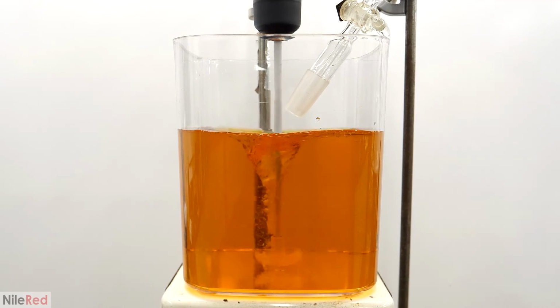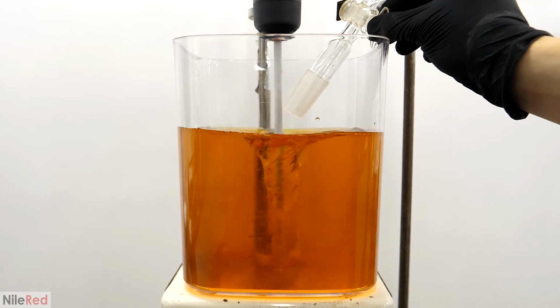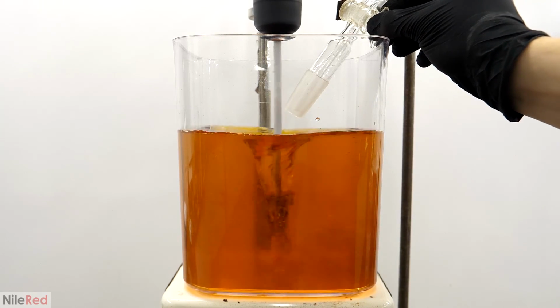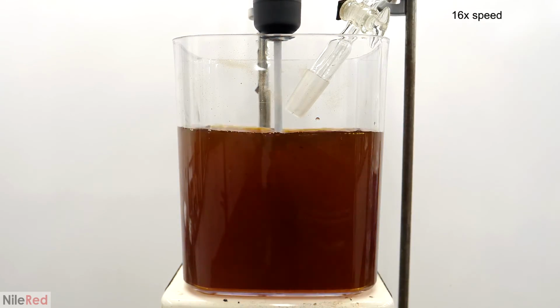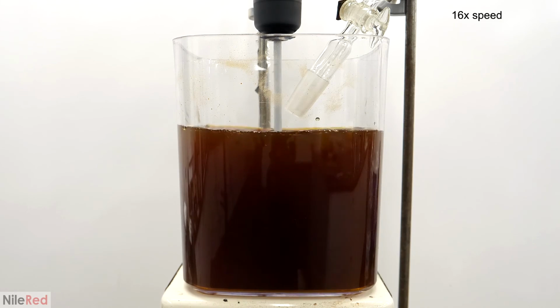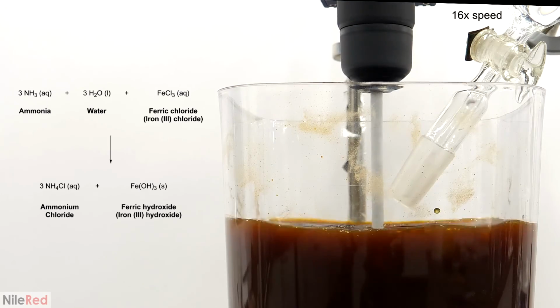When the 10 minutes were up, I increased the stirring to about 1200, and I opened the addition funnel. Almost immediately, it formed a bunch of dark solid, but the mixer quickly scattered it, and it disappeared. As more was added though, it started sticking around, and the whole thing eventually turned brown. This was because when the basic ammonia was added, the pH slowly increased. When it got to above around 4, it started reacting with the iron 3 ions to make brown and insoluble iron 3 hydroxide.